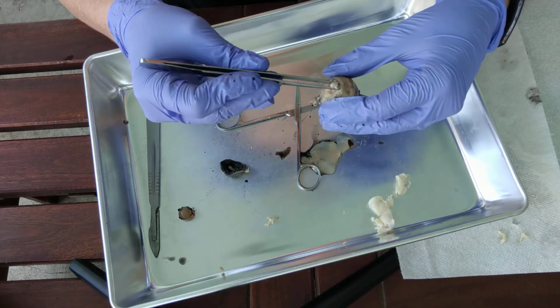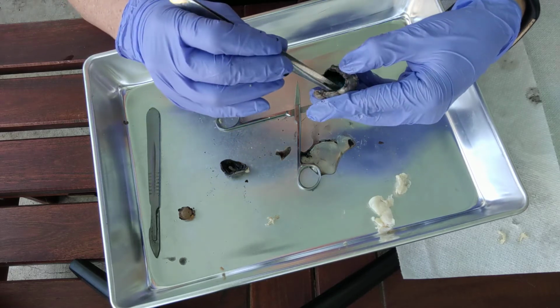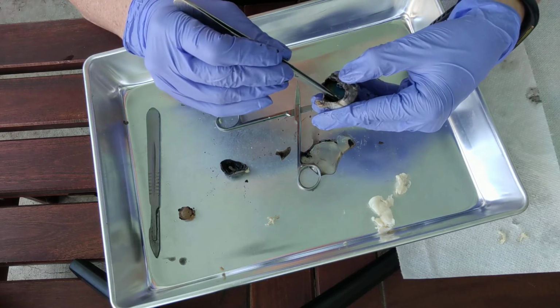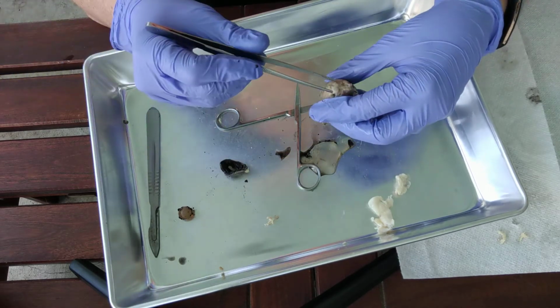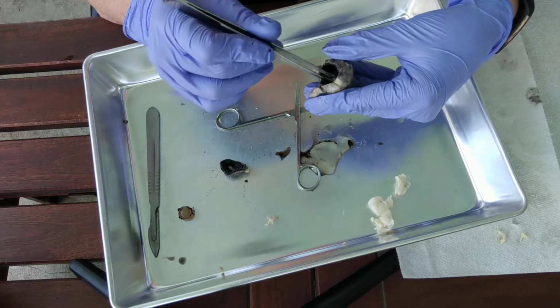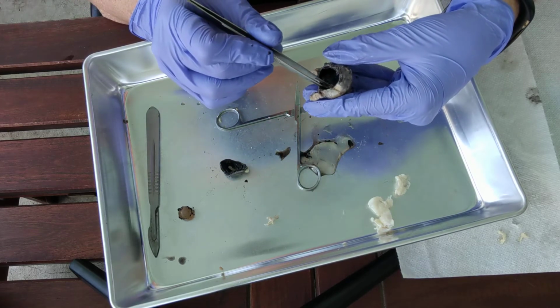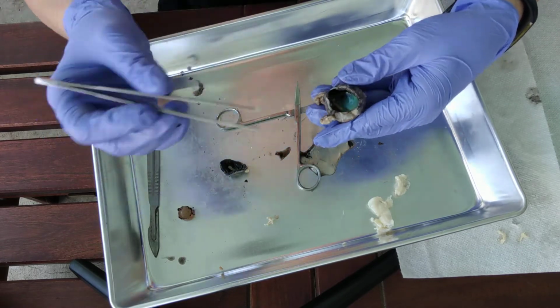The place where the optic nerve exits the eyeball is the optic disc. Because it's gathering together and then exiting out through the optic nerve, that's where the retina stays attached. So that spot right there is the optic disc, the blind spot.